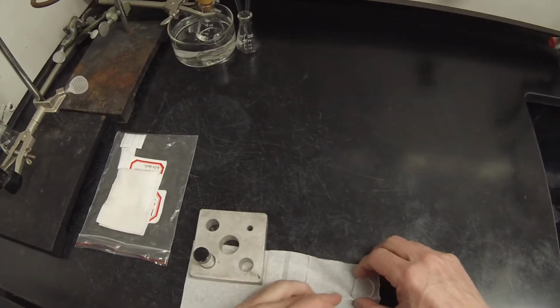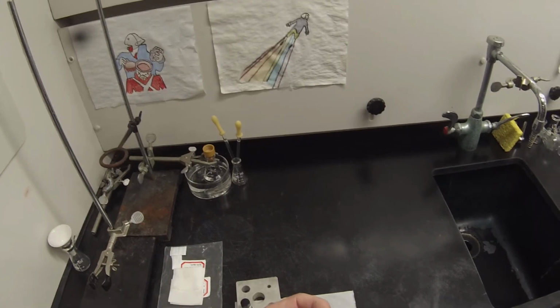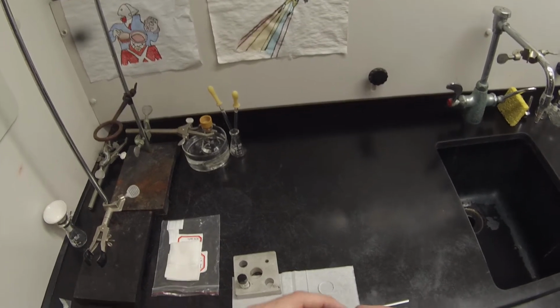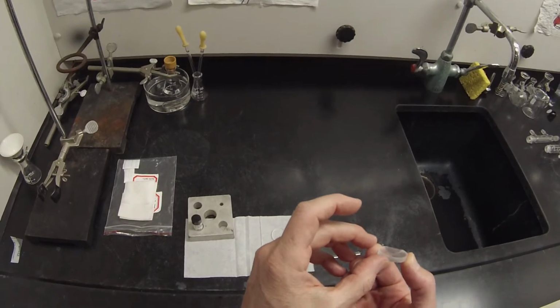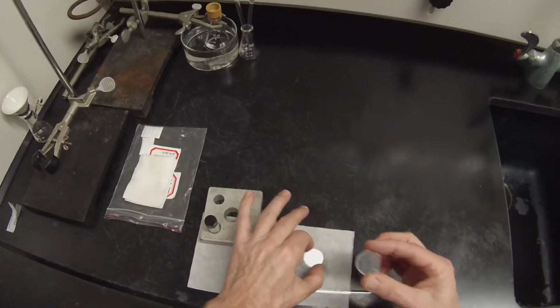So as always, we kind of want to look and see if we can find the flatter of the sides, the one that looks like it's less damaged. This one looks like it's a little damaged on that side, but maybe not on that side, so I'm going to use that one. And then this one's definitely got a crack. The crack appears to be on this side, so I'm going to use the two sides that are not cracked.